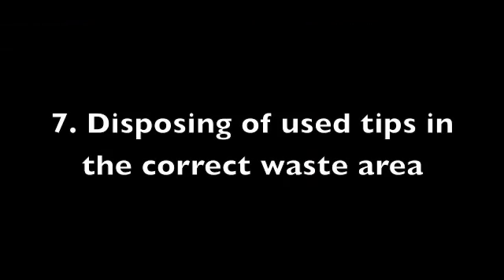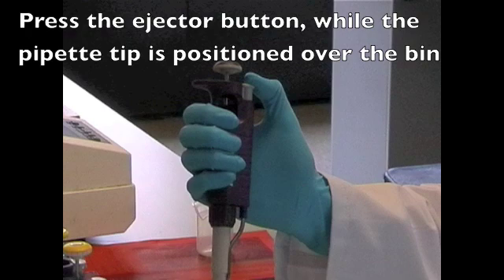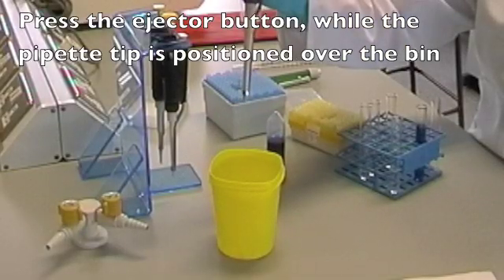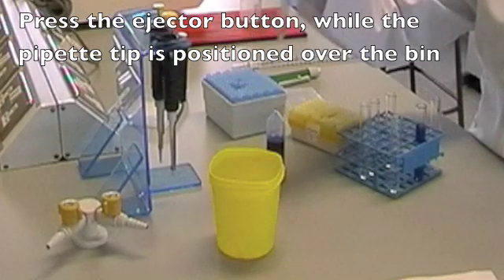Disposing of the tips in the correct waste receptacle is important, as a cluttered bench will lead to errors. Grasp the pipette firmly and press the grey ejector button located on the side of the pipette. Ensure the tip is pointing into the yellow bucket on your desk and press down on the button. After the class, you should empty the yellow bucket into the correct bin at the top of the lab.